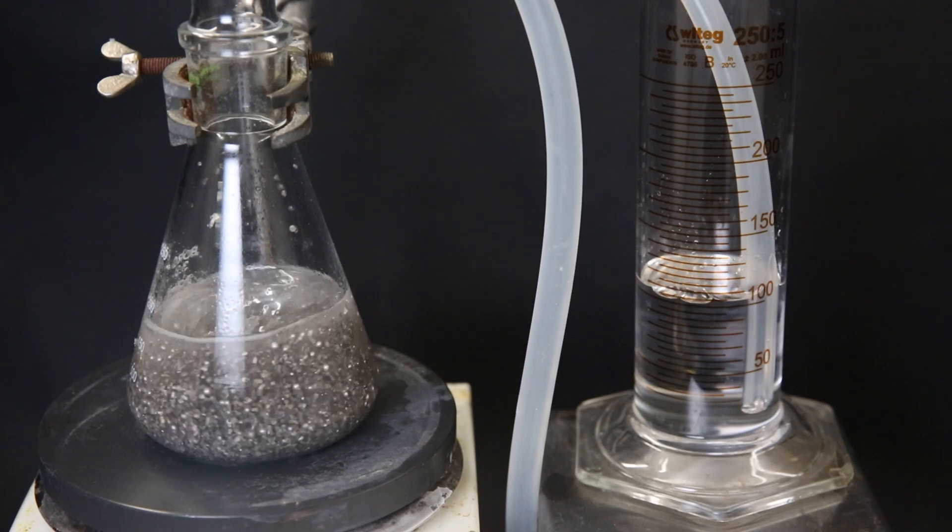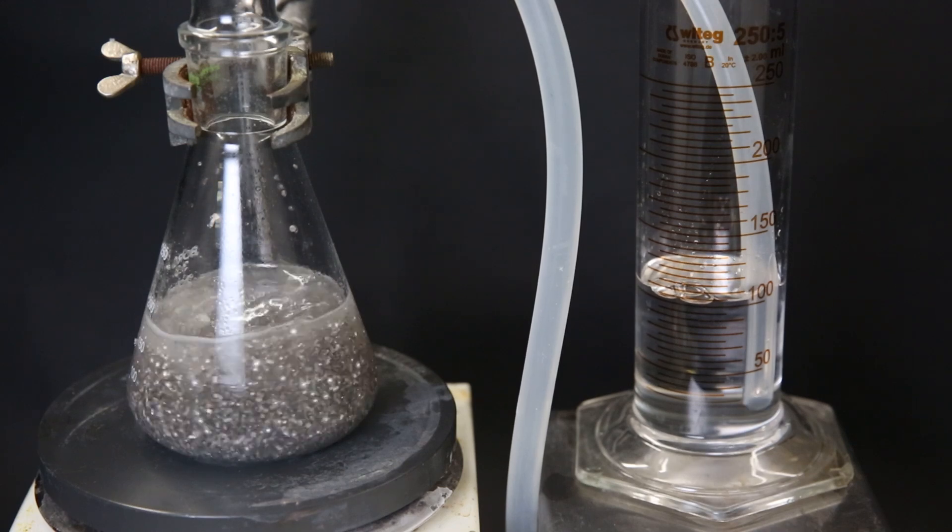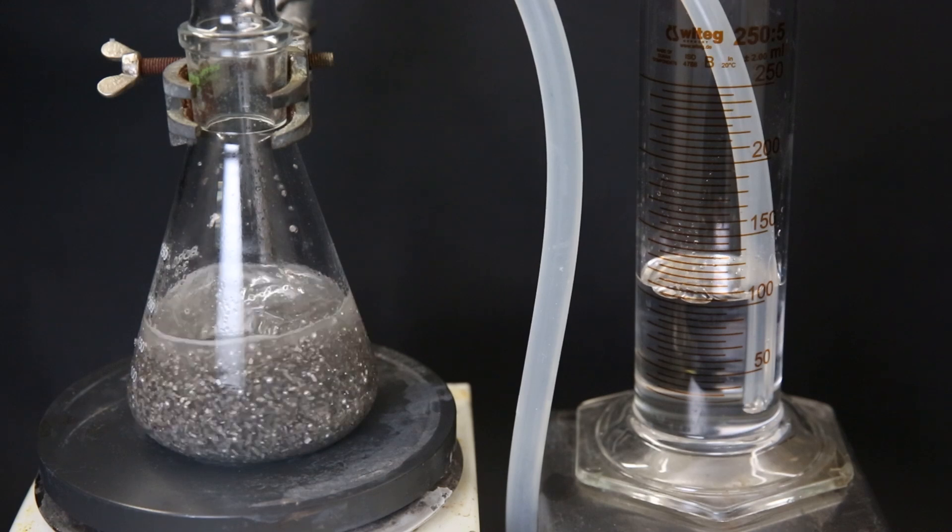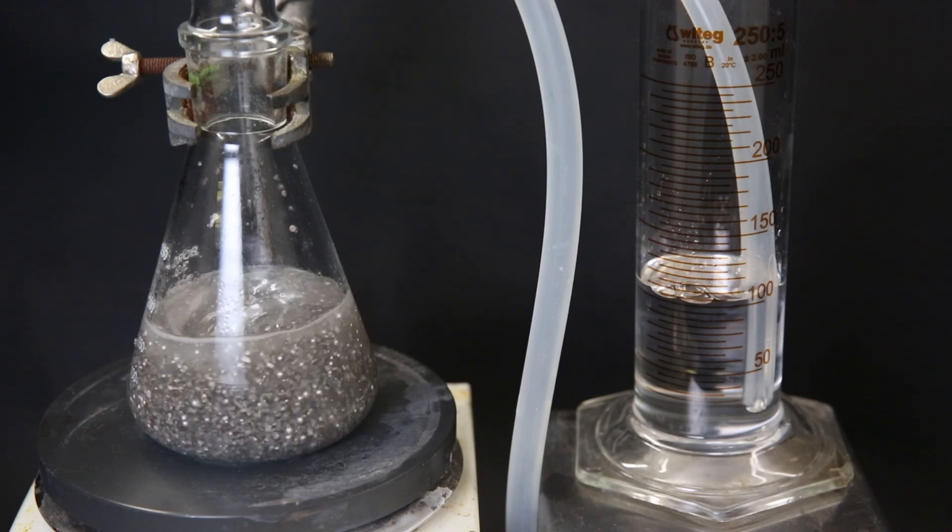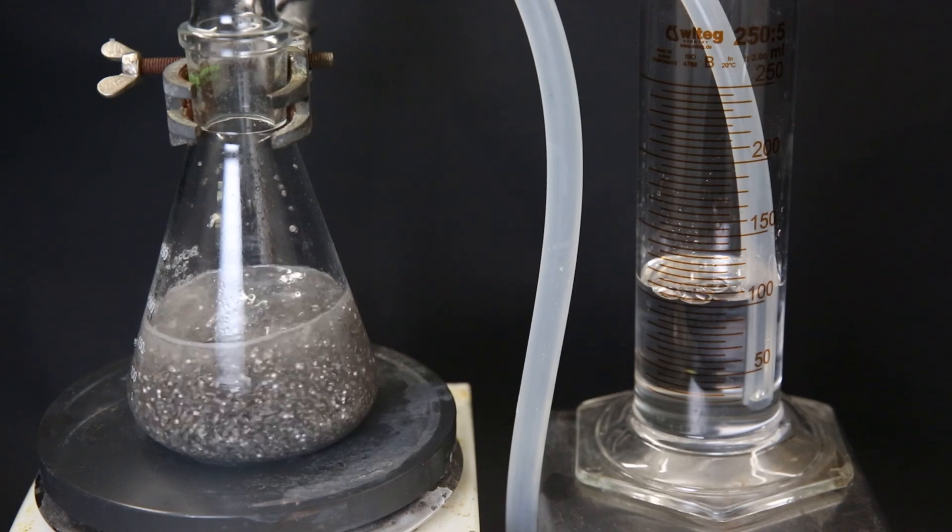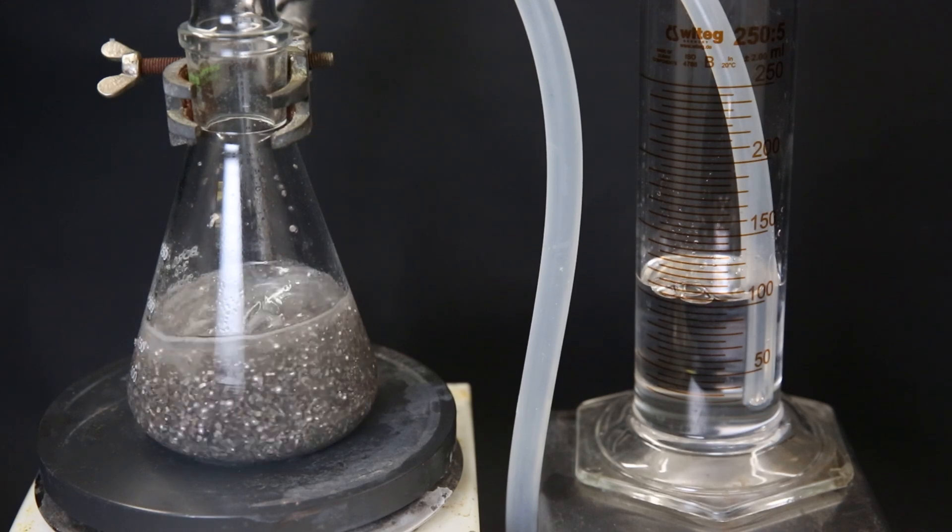What is happening in this reaction are several steps. At first the hydrogen gas will mostly be from the sodium and menthol working together to remove water from the mixture. This will take a while since water that is present in the sodium hydroxide has to diffuse out first.